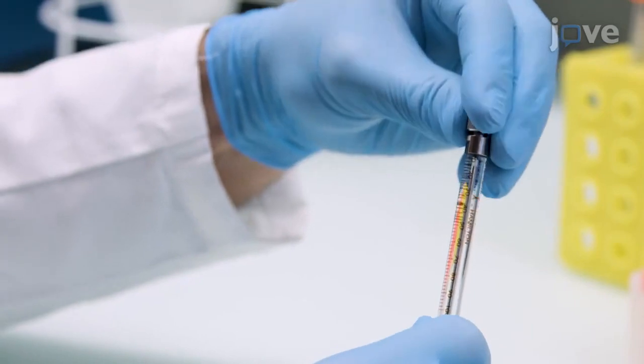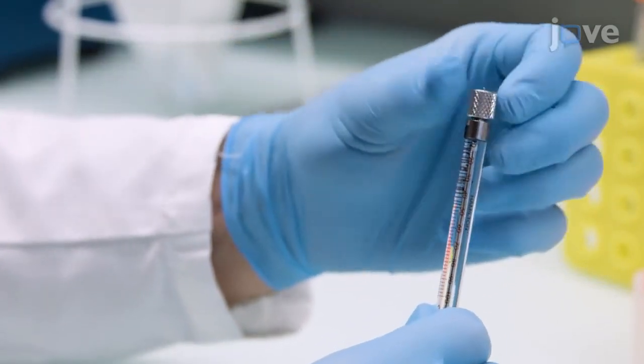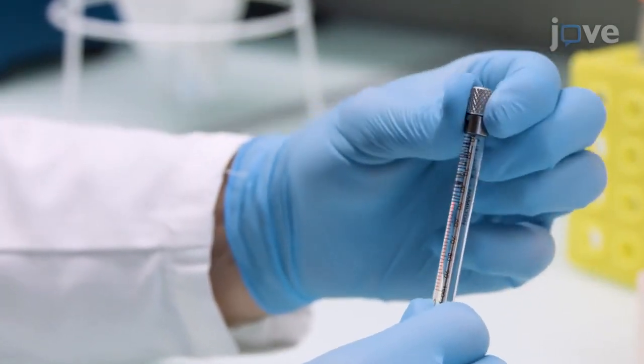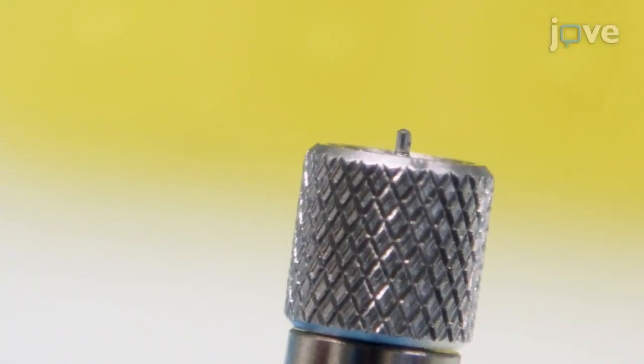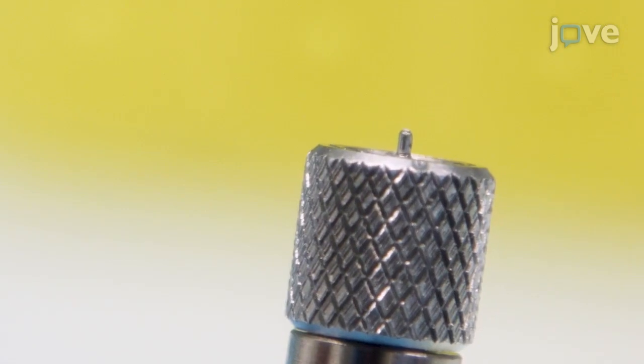Connect the syringe with MAG 7.9 and paraffin to a standard syringe coupler. Purge the air from the coupler by gently pressing on the plunger until a small volume of the mixture is visible at the tip of the coupler needle.